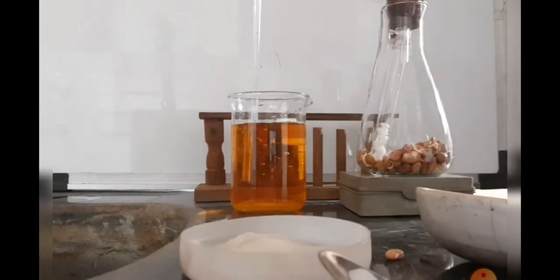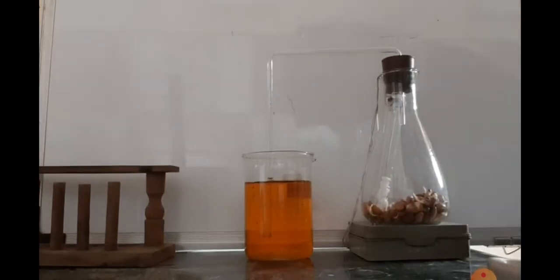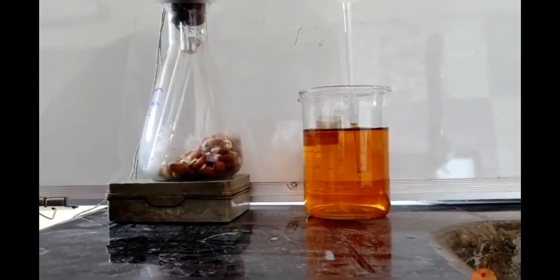Then we have to keep our setup as it is for 5 to 10 minutes. After 5 minutes, you can see that the water level is slightly rising — the level of water is slowly, slowly increasing. The water level is slightly more compared to the initial one. This shows that the carbon dioxide evolved during respiration is absorbed by KOH, that is potassium hydroxide, and therefore the water level in the bent tube rises.